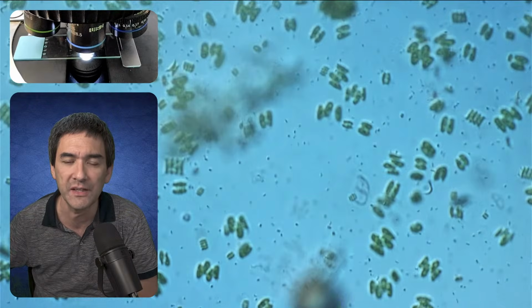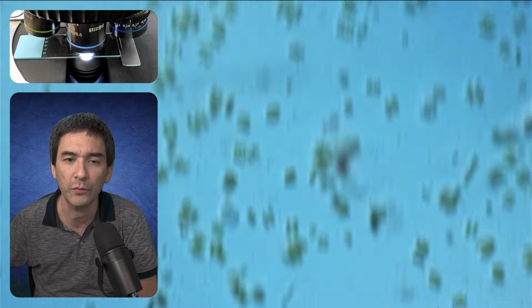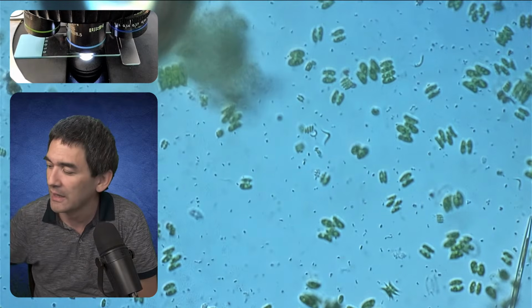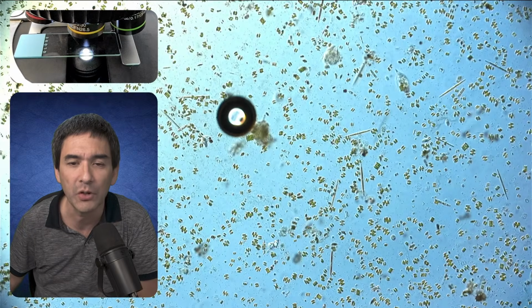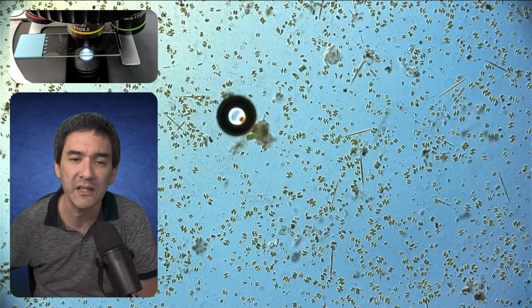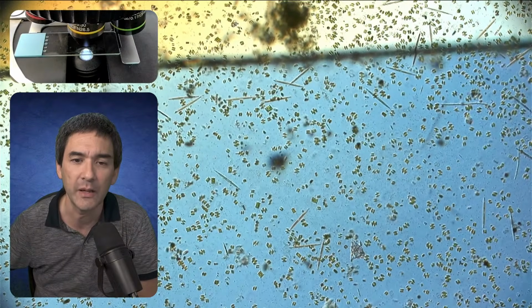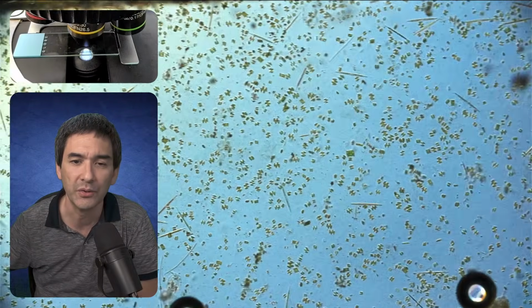that I made a couple of days ago, is that those bacteria in the background are going to start to move towards the edge of the cover glass, towards more oxygen. But that is something that we actually might not be able to see well today, because there is simply too much oxygen present anyway, because of so many algae, right? Look at all of this density that we have here. It's quite something going on.